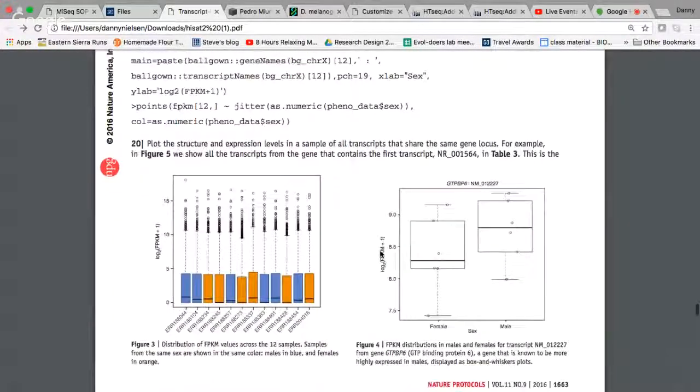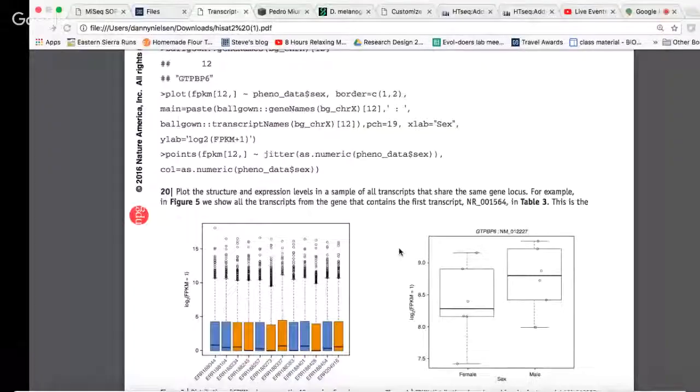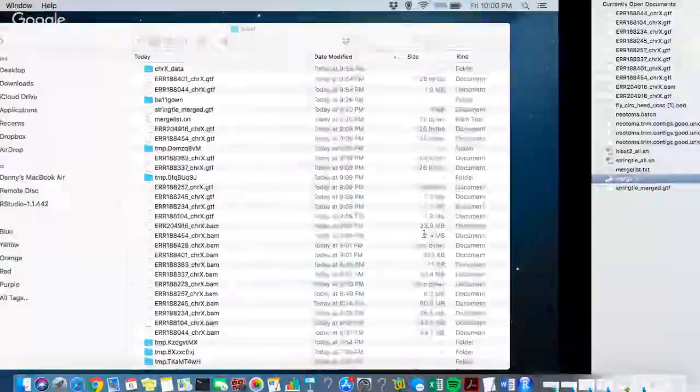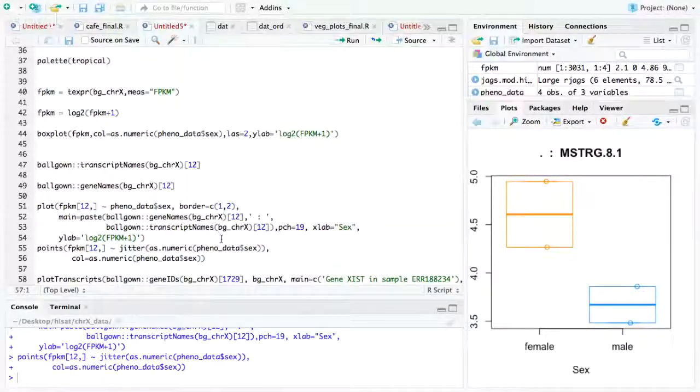So this is a transcript plot, plots of individual transcripts across samples. So I've got that. We've got the 12th transcript from the X chromosome is what we're plotting here.